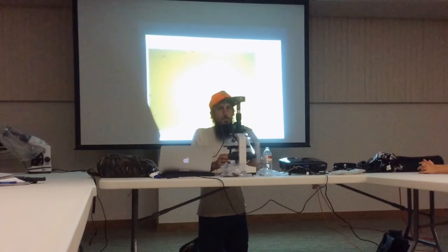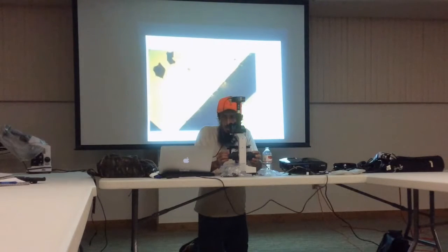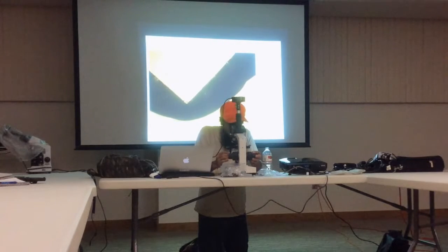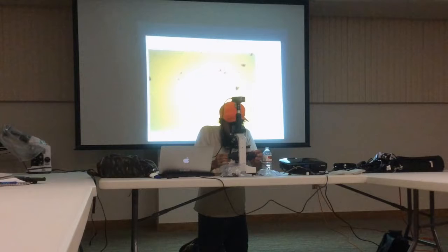Because they're big enough, and riding around, that it's worth a little bit of time, just before you start to really look into the slide, to just go across. And this is the edge of my slide. You guys see that? That's the edge, so I can see from edge to edge, just kind of cruising across my slide. See if I see any nematodes.